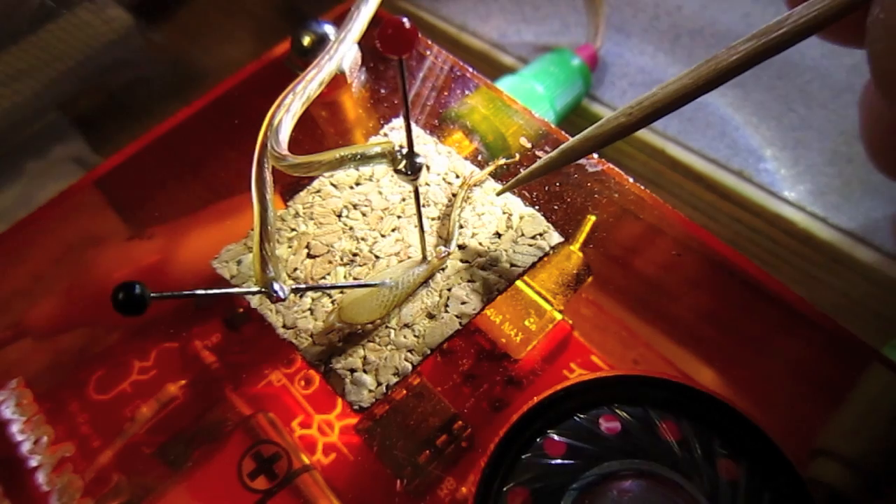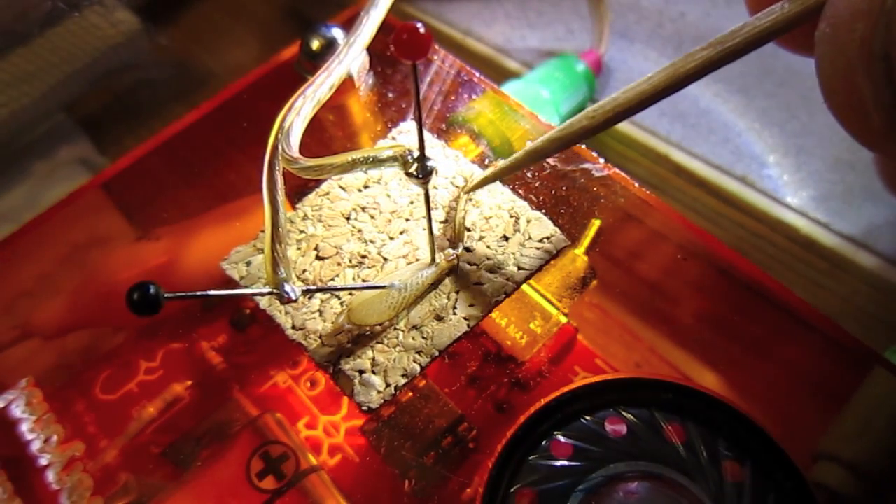Now let's have both electrodes in the femur. This is what we've done in the past without much luck. There is a response when I touch the barbs on the tibia, but it's rather weak.